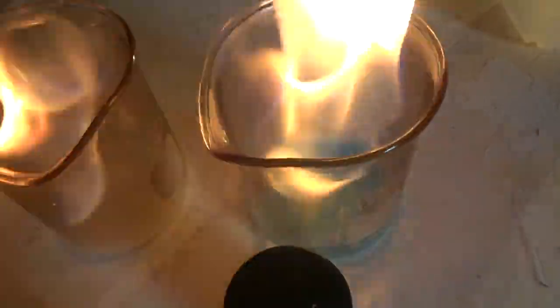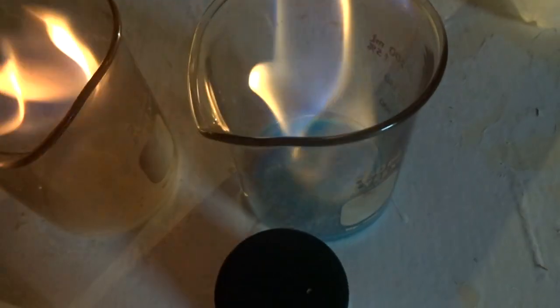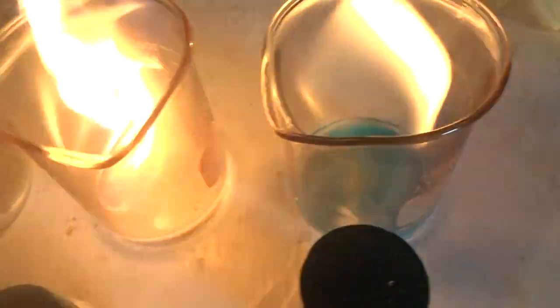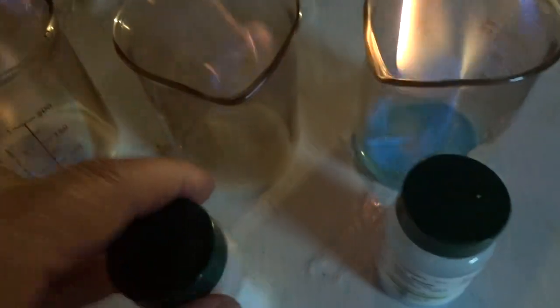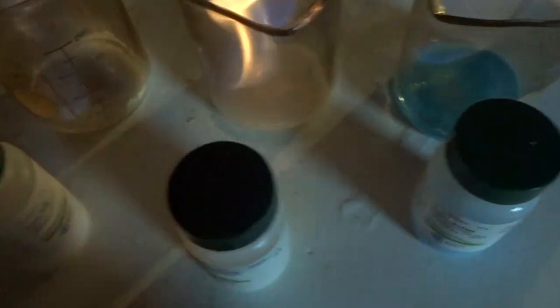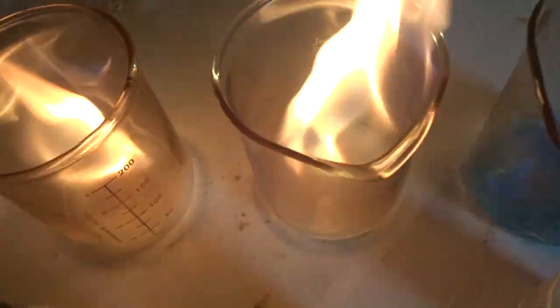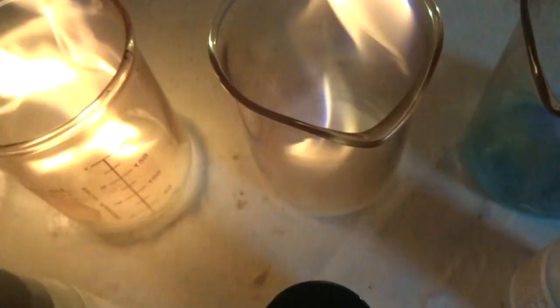The copper is green, but I don't see the green color, but it's supposed to be green. The strontium is supposed to be a different color, I don't know, I'm not sure, the red, but it's not flashing red right now, I don't know why.